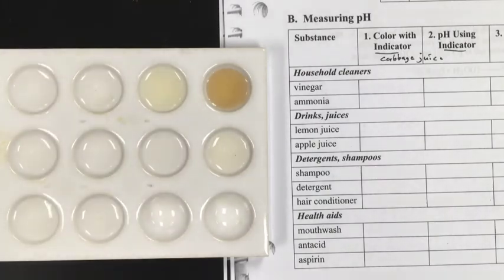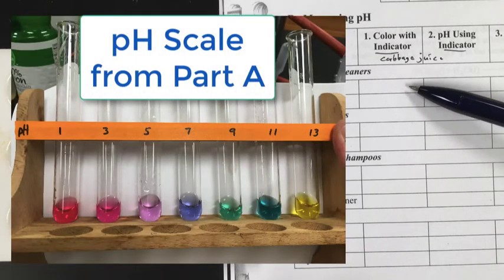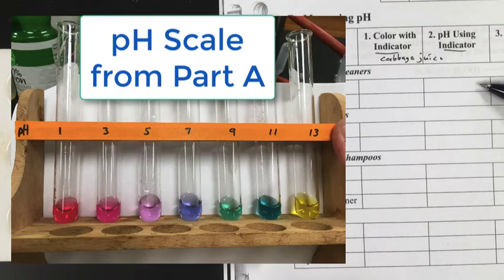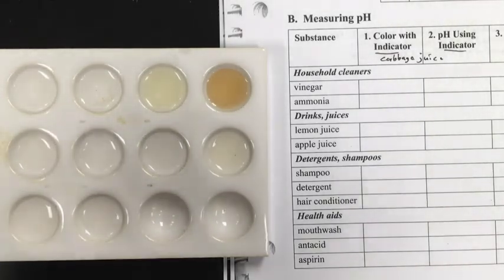First we'll observe the color change when I add the cabbage juice, and then based on that and the pH scale from part A, you're going to take the color that indicated, like with the vinegar, and determine an approximate pH value based on the color change from part A. I'll demo that a little bit too. But first off, let's add the cabbage juice to each one of these samples so we can see the color changes.